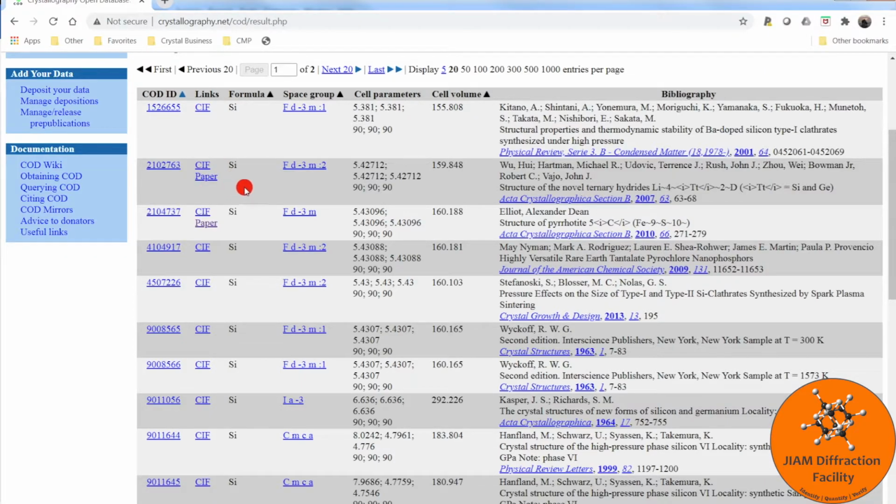Here we have the formula, space group, cell parameters, cell volume, and then a little bit of information about where the CIF file comes from. If you were to click this paper link, it will give you more information than what is contained here. You can use this information to look up the paper and determine if the information contained within the CIF file is reliable.